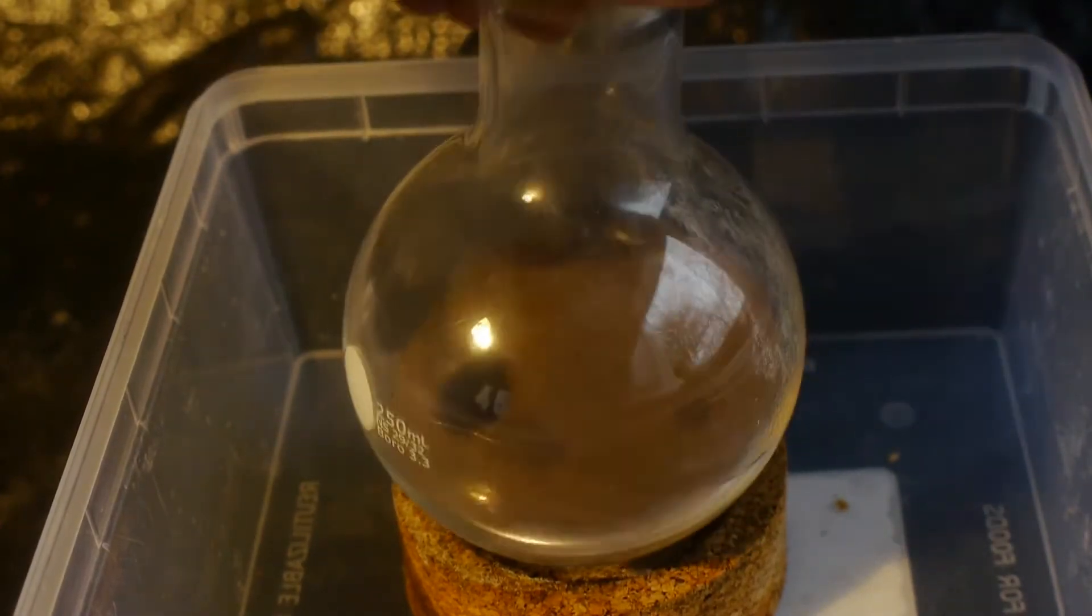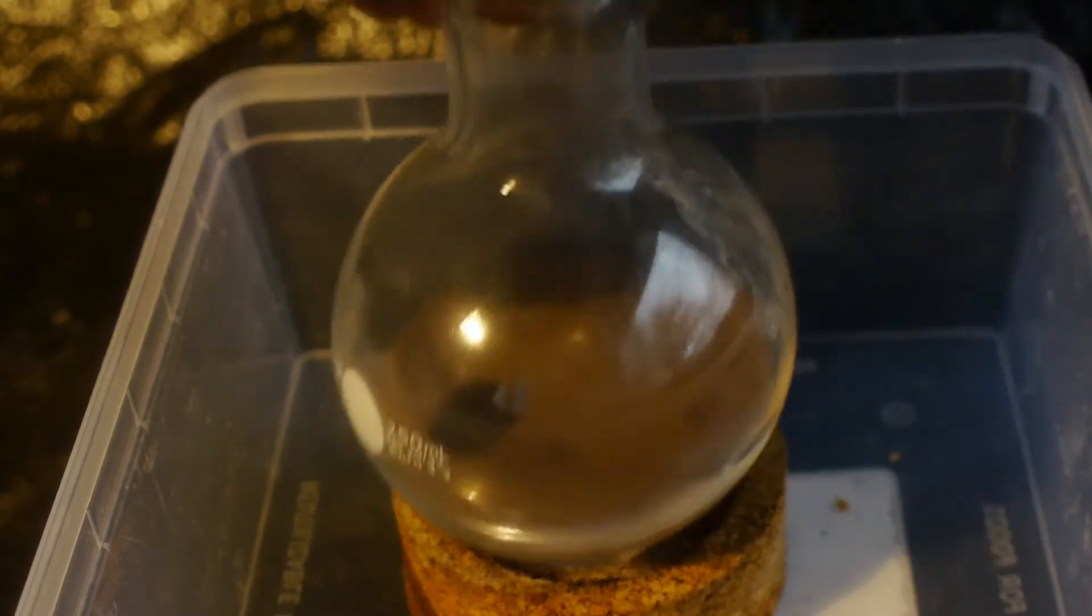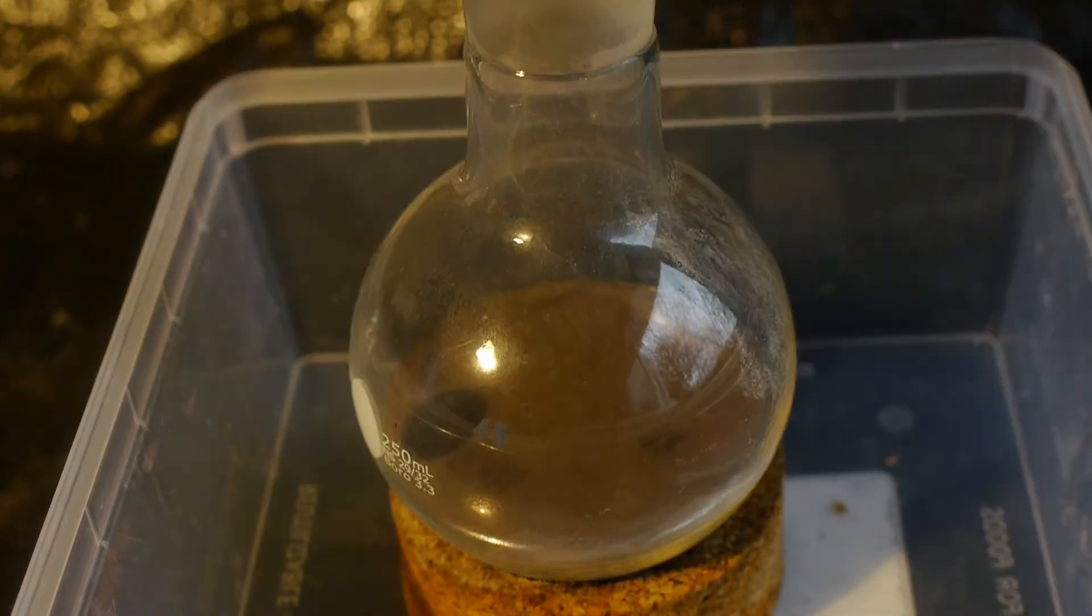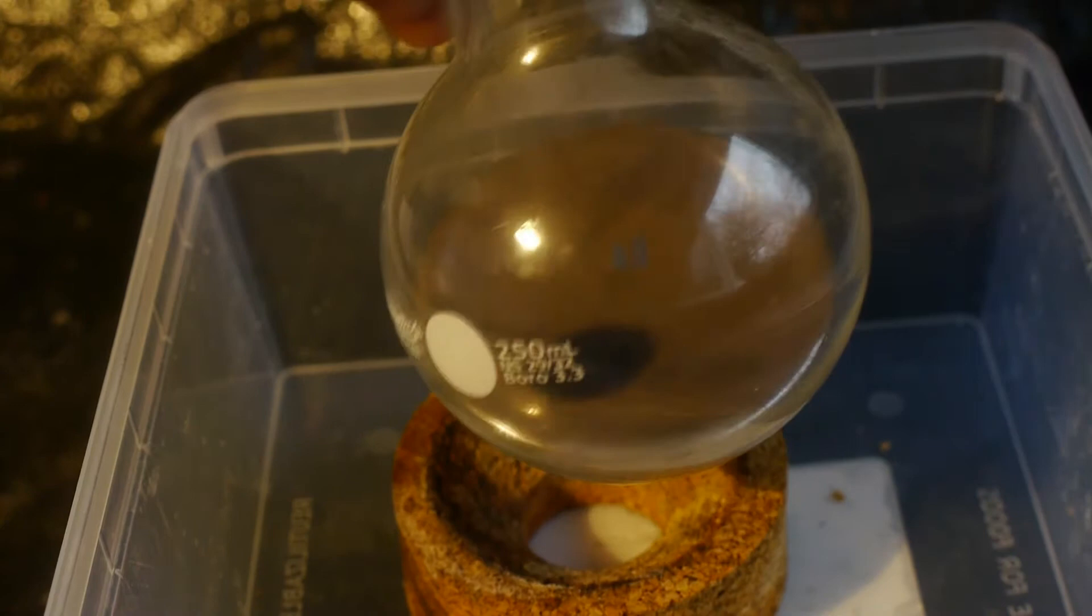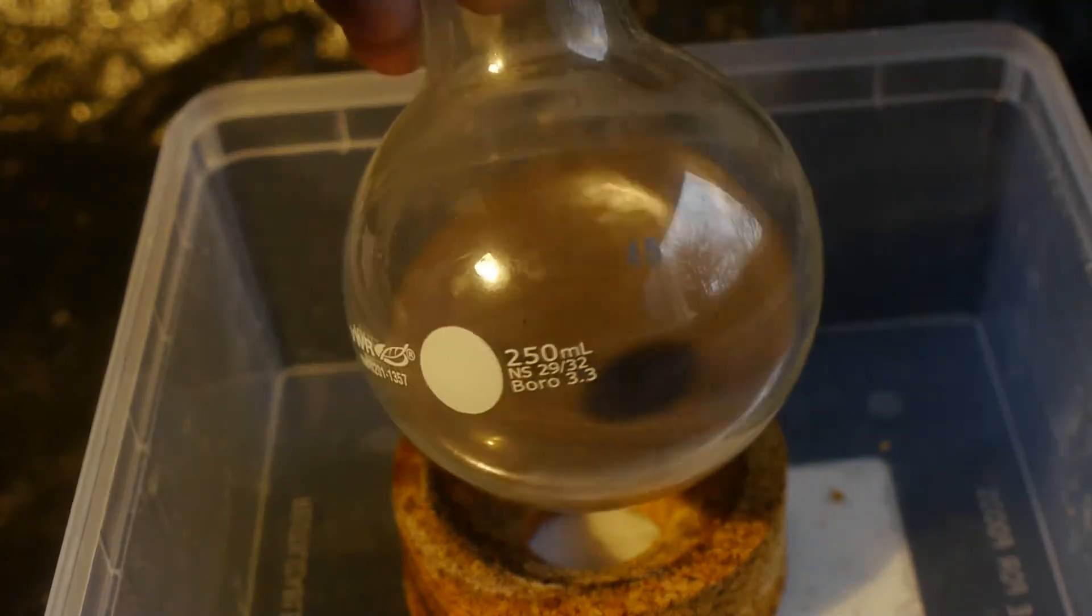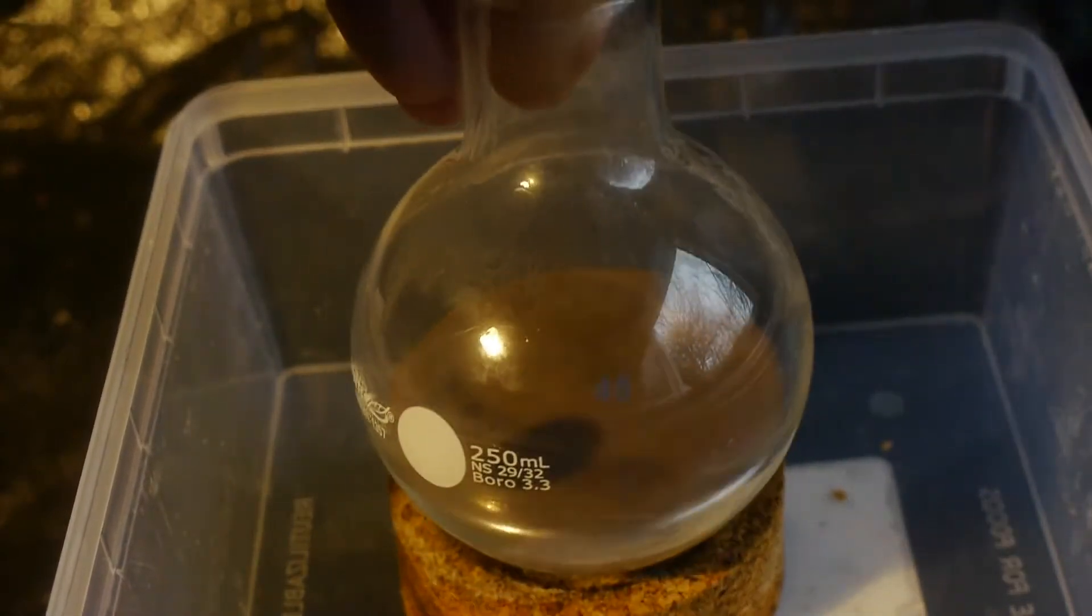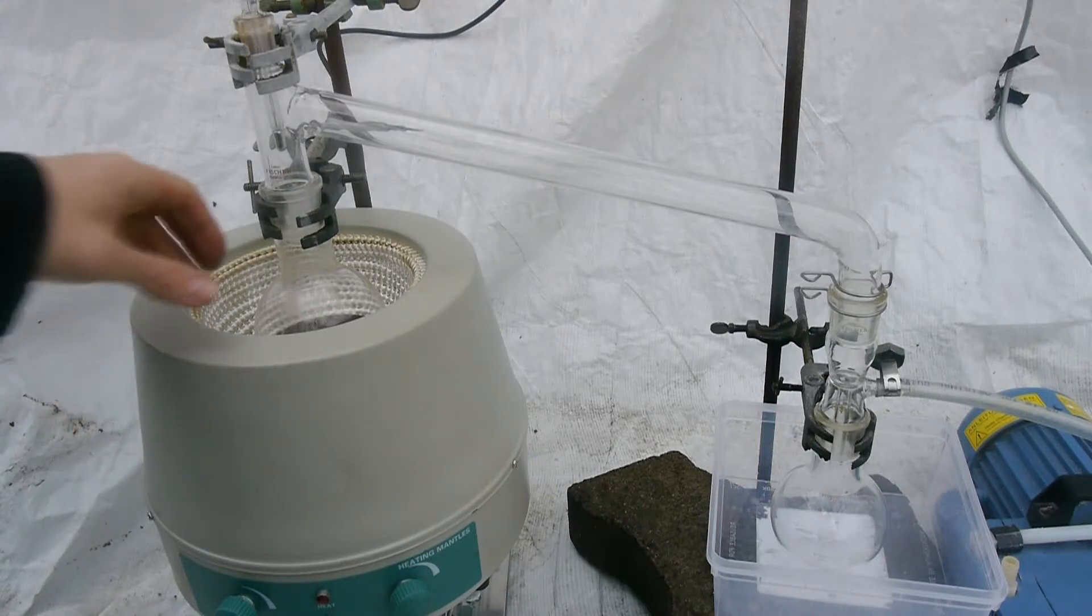Because elemental mercury is practically not getting absorbed through the skin or the stomach. But because during the distillation we are going to turn this all into vapor, I am going to have to be particularly careful. The distillation apparatus is set up.